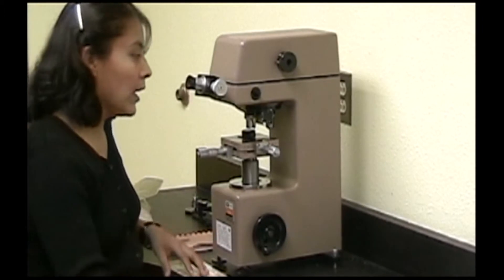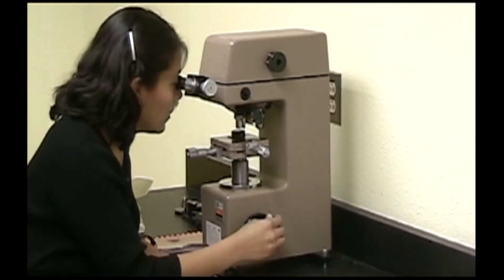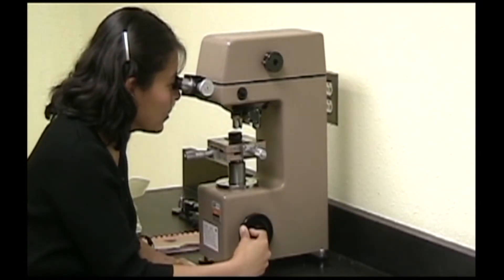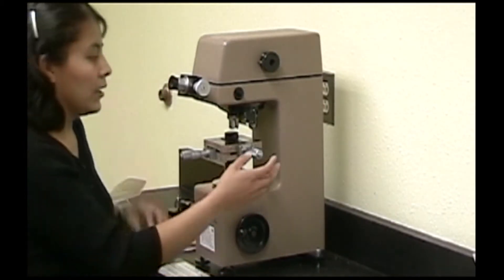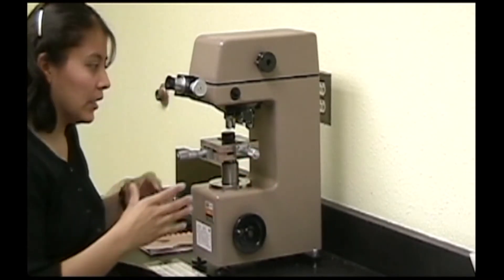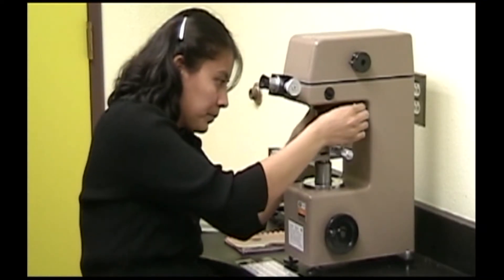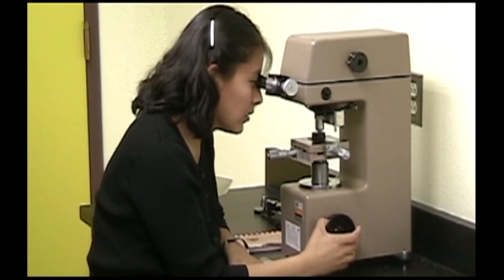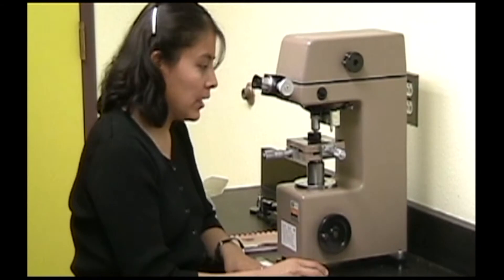While looking through the eyepiece, move the stage down while focusing on the surface. Once it's focused and you've chosen a test area, carefully switch to the 40x objective lens, refocus, and decide exactly where you want to test.